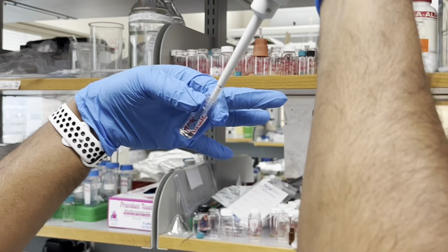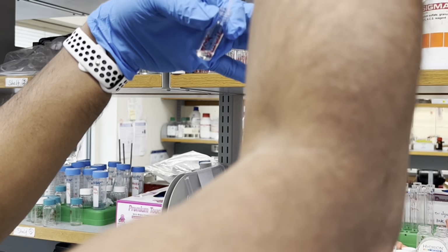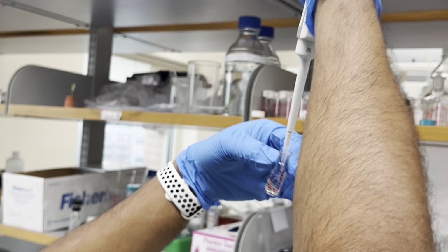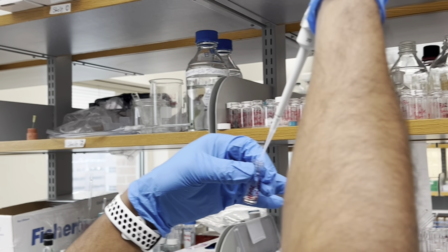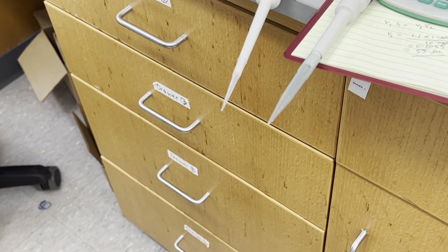When you are adding, try to dip in the liquid and then add, because it is a very small amount. It's a one-time use, then you toss the tip. Since you dipped it and shook it, that pipette tip will contain some liquid at the top. In that case, use that one for the pH change. If you want to add more acid later, you have to use a different tip, because you want to preserve your acid.